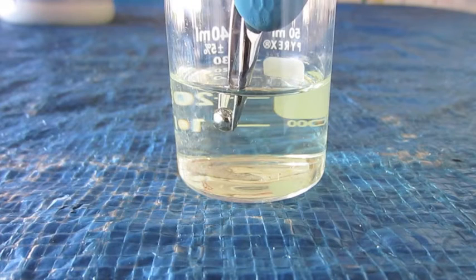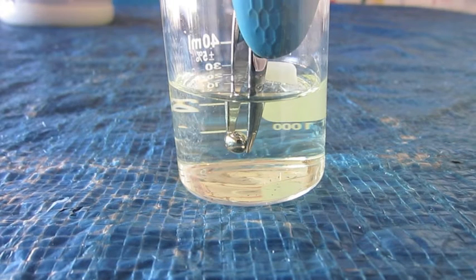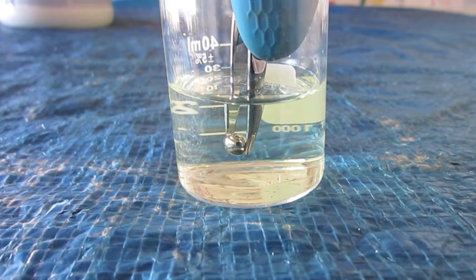I'd seen Nerd Rage's video with ruthenium, and he had apparently shown that ruthenium has kind of an Achilles heel. When you put it in bleach, it actually starts to react. I tried this, and this is a shot of the ruthenium in bleach, but as you can see, it didn't react at all. I'm not sure what I did wrong, if I didn't wait long enough, though I waited quite a bit of time, or what was wrong, but this just goes to show that science is sometimes unexpected.